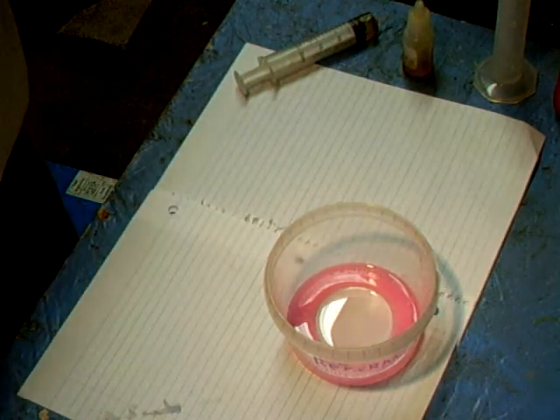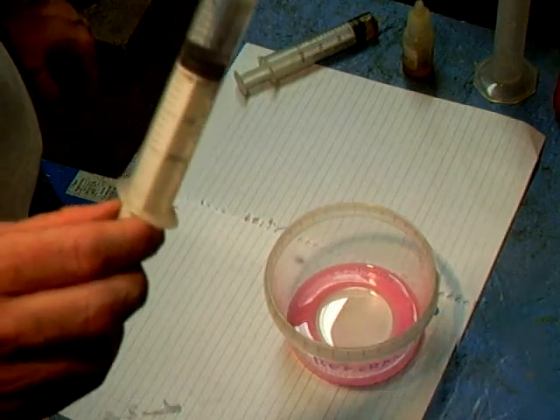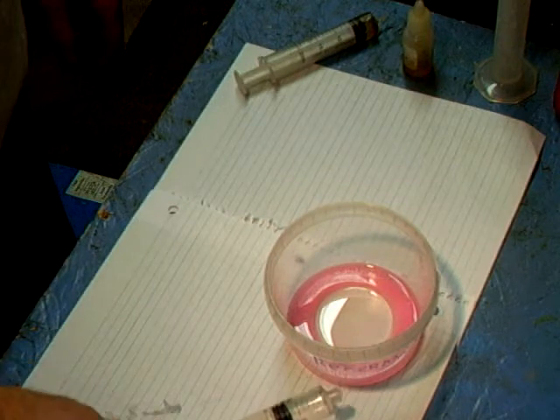Half of that number — half of the number three — will be added to the overall batch.